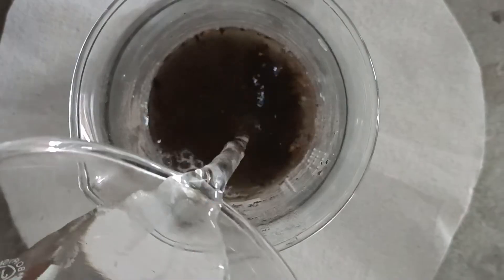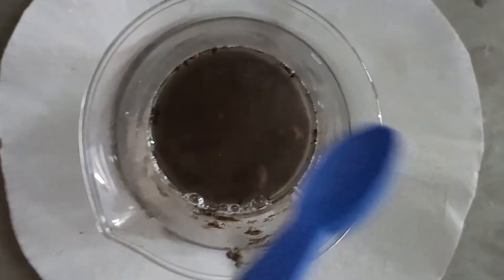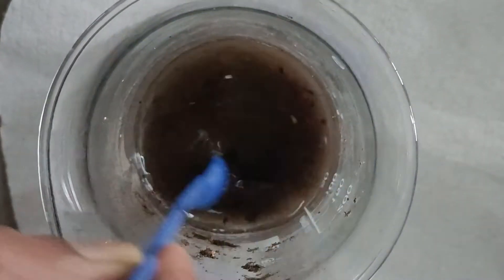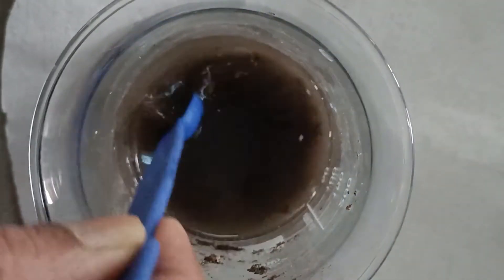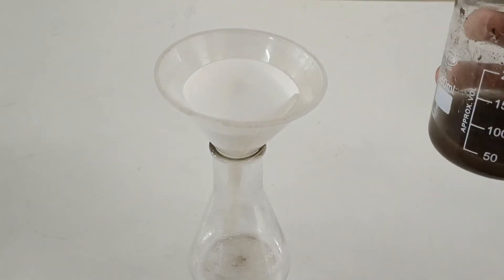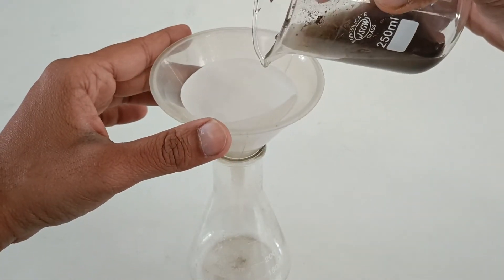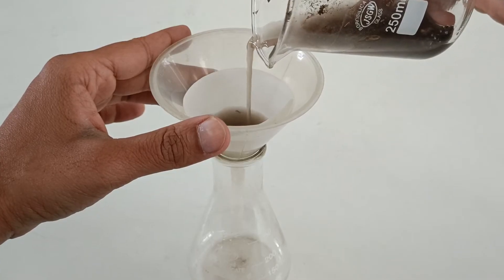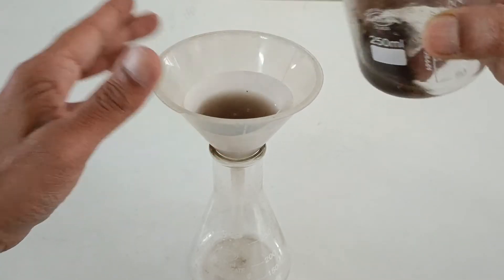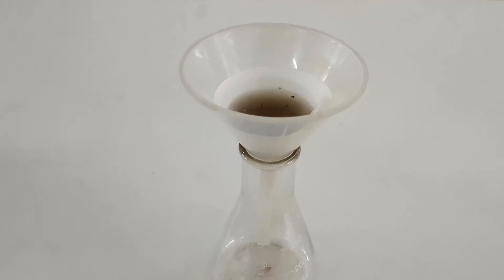Adding some water to the sand and stirring it well to make a mixture. Pour the mixture over the filter paper and you will notice that the water flows out of the filter paper slowly into the conical flask.